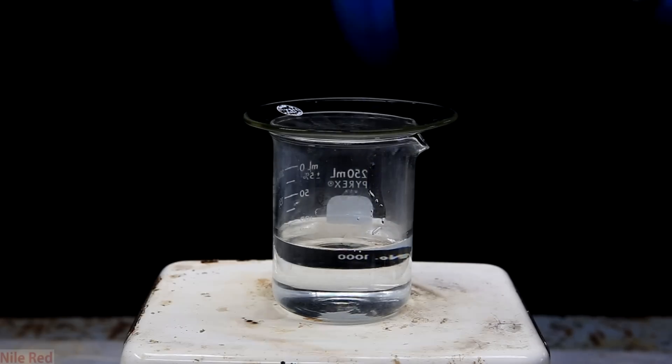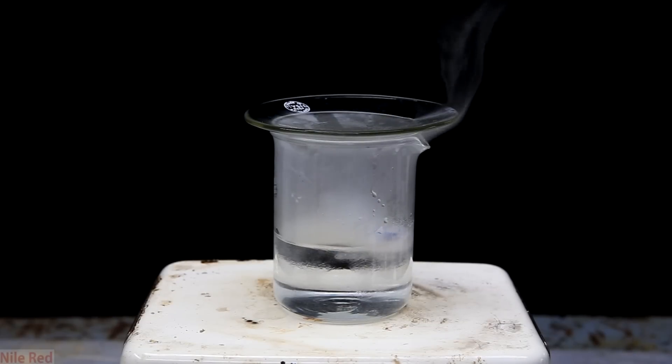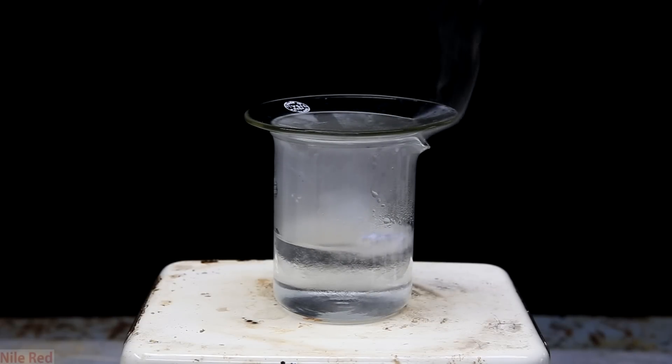Okay, so today we're going to be making some lithium hydroxide. It is a strong alkali metal hydroxide, which is a base.